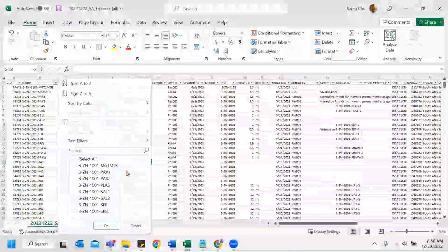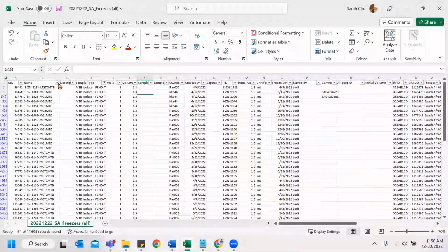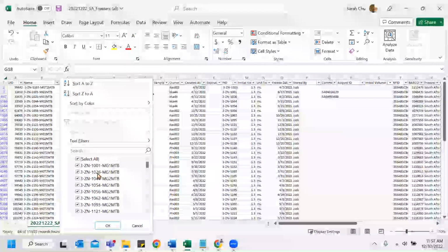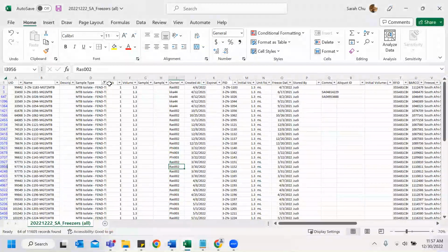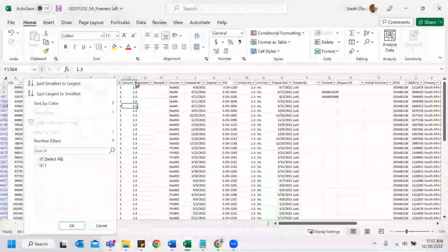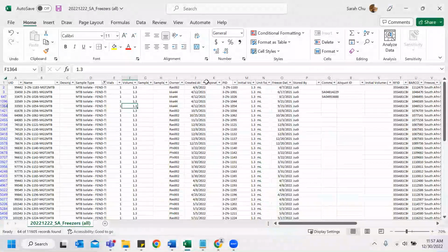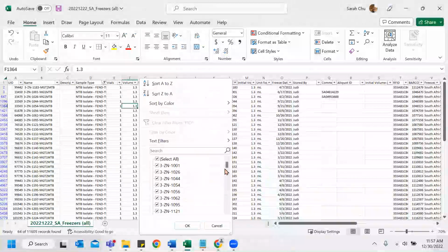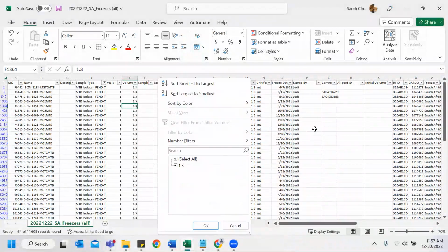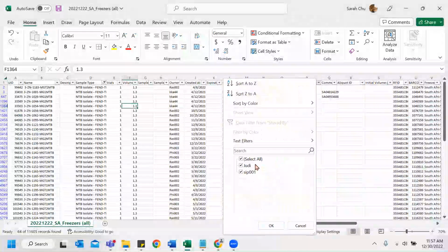No blanks here. Anything out of the blue, MTB, GT. Okay. Vials are okay. Volumes, there are no blanks, no zeros. This is filled. Seems all right. PID, any random blanks, extra dashes, weird things. Okay. Initial volume is also good. Unit, nothing strange. And stored by, you see the name Judy.